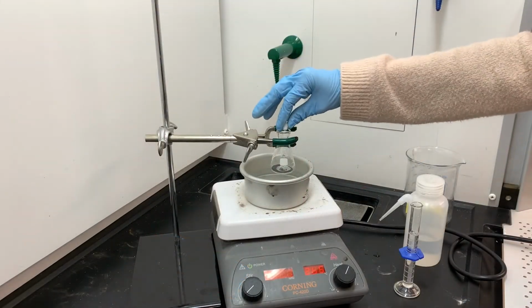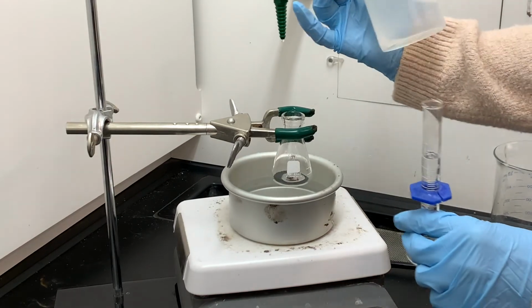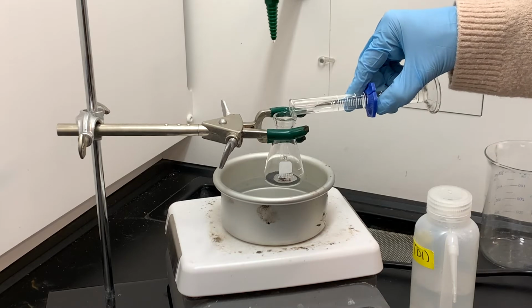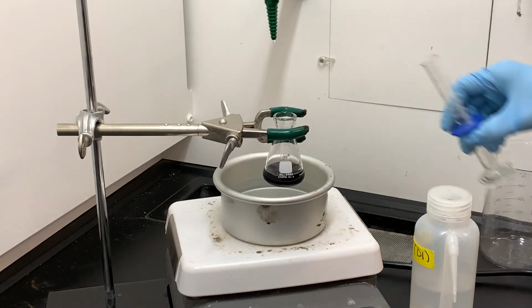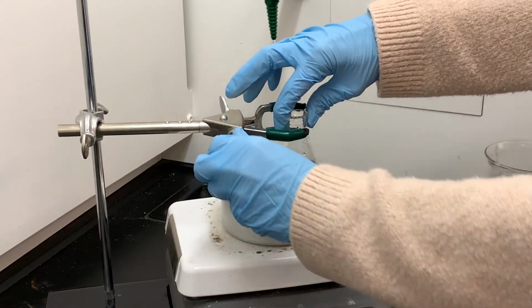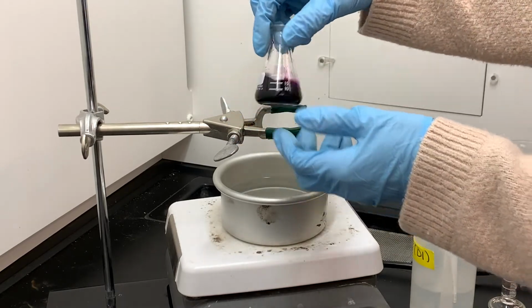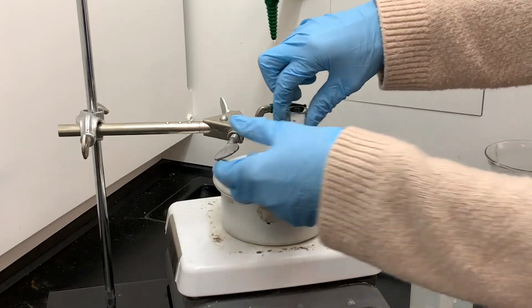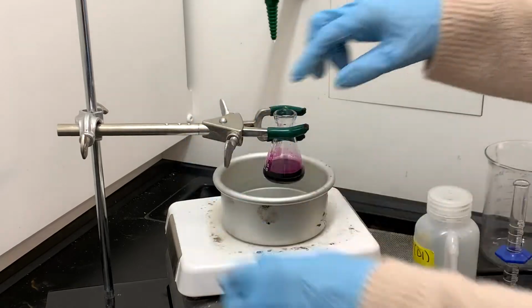So I'm adding a little stir bar to the Erlenmeyer flask, and I'm going to be putting 10 milliliters of deionized water into the flask as well. This is all going to get dropped down into a water bath. I'm going to heat the water in the water bath up until it starts to boil. This reaction does require quite a bit of heat. Notice a really bright purple color, that's the potassium permanganate. So once this solution gets nice and hot, starts boiling, then I'm going to add the anise oil.